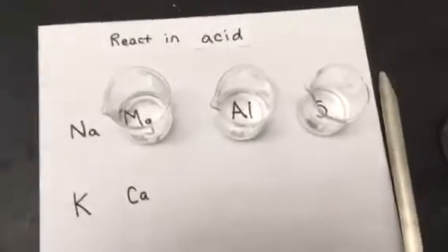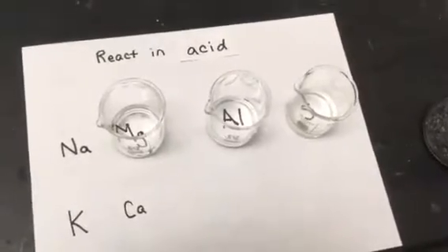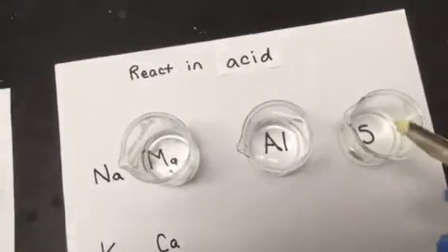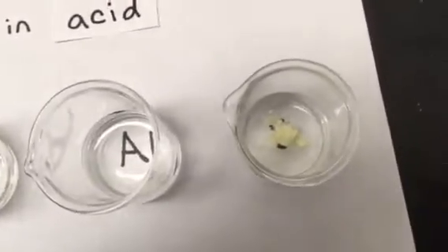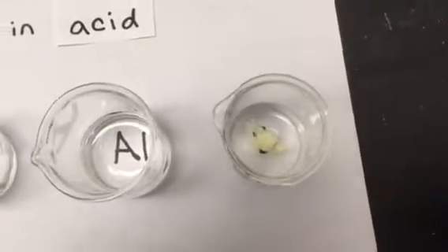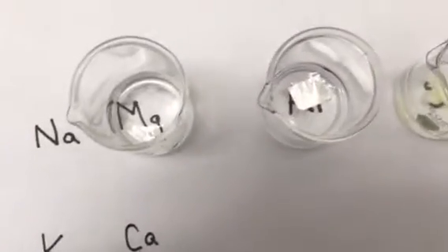So what we're going to do with these is we're going to react these three in acid. So in these beakers is hydrochloric acid, and we're just going to add the same elements to them and see if they do anything this time. So once again, we're going to start with sulfur, put that in there, and then we're going to put some aluminum in next. So if we take a look at the sulfur now, we see that once again, it's not really doing anything. So that would be a no reaction for that one. Okay, so then we'll put the aluminum and then we'll put the magnesium in.